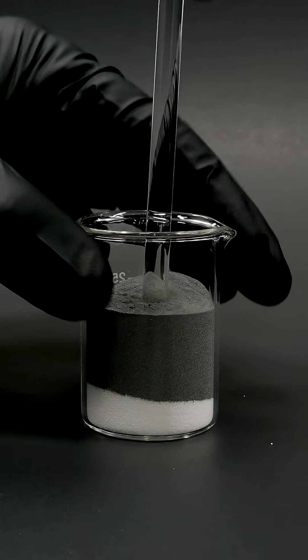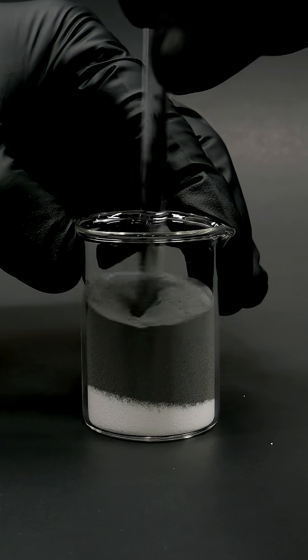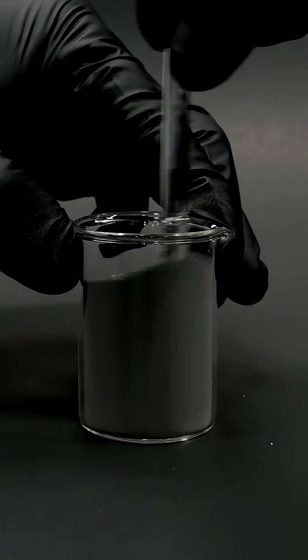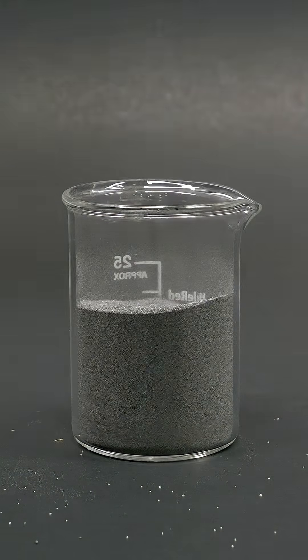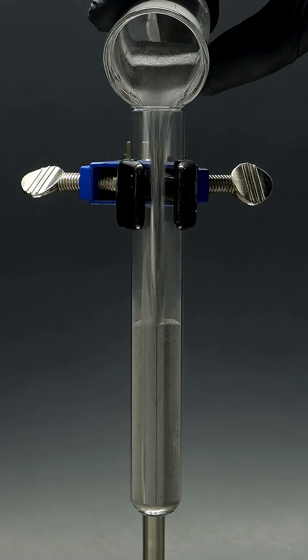Now with both of these loaded in, I just need to mix them together. After stirring for a few minutes it's looking pretty nice and even, and I can pour it all into a big test tube.